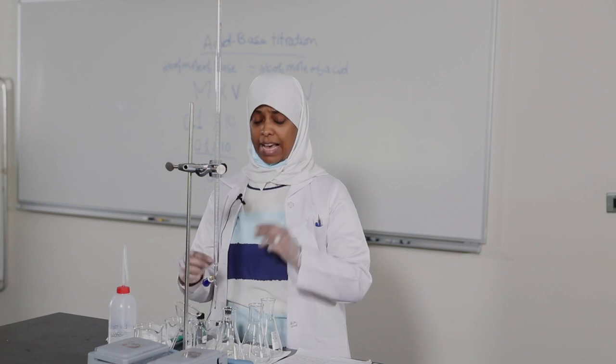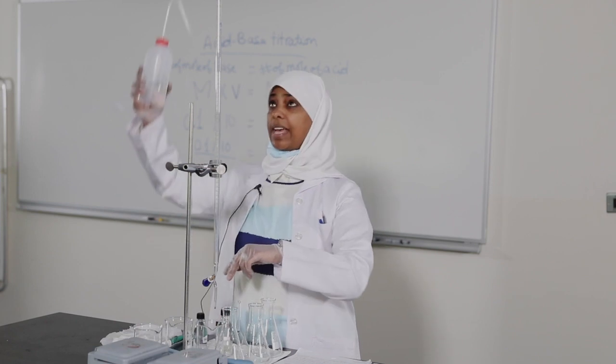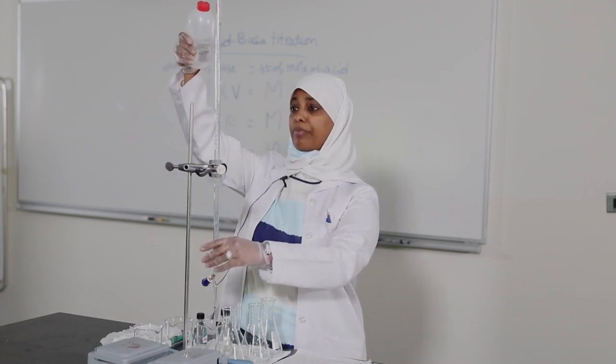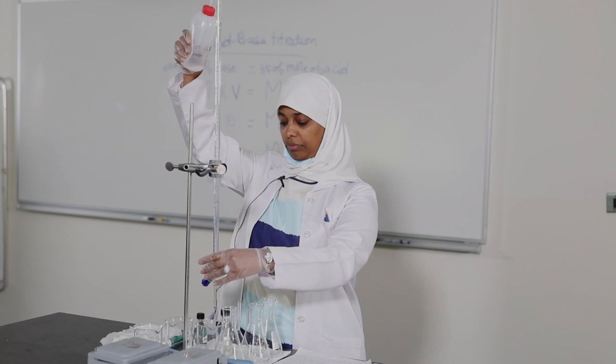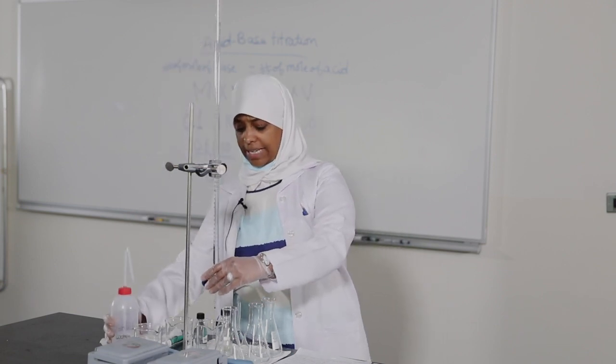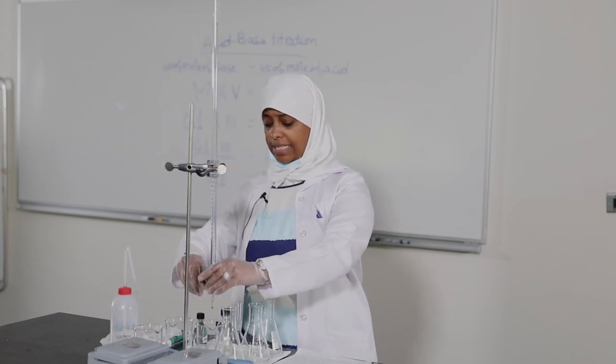The indicator is used as a helper in the titration process so that the required color change becomes clear. Before using any instrument in the lab, we have to wash the burette using distilled water to avoid any contamination from previous uses.